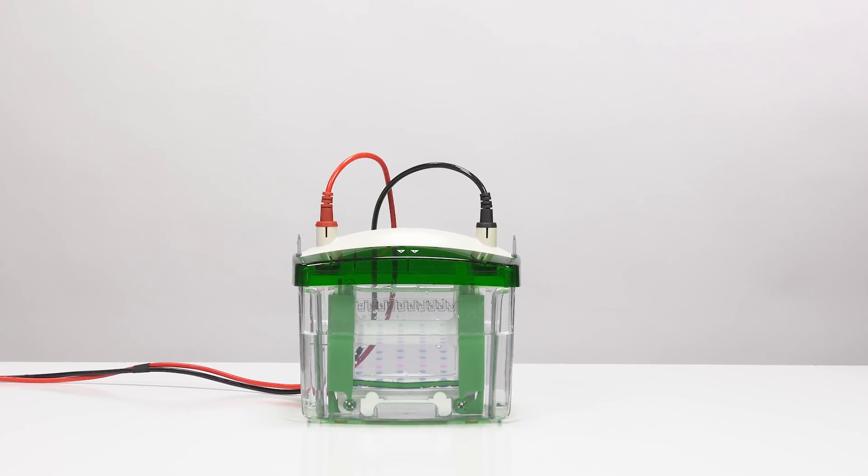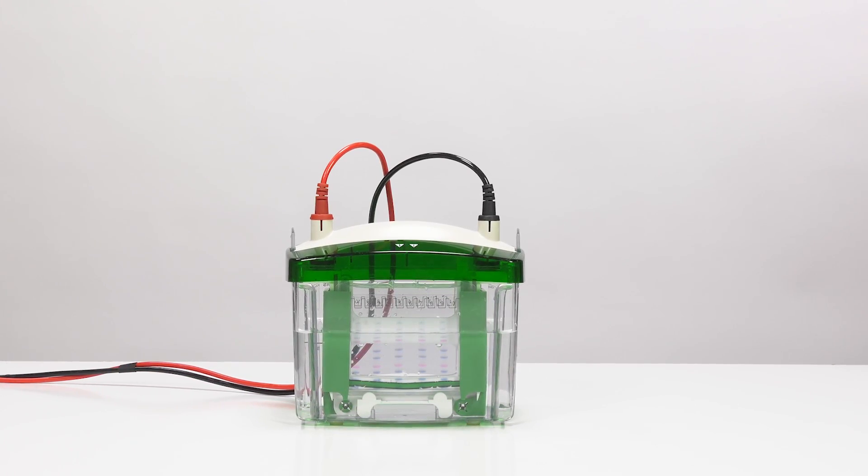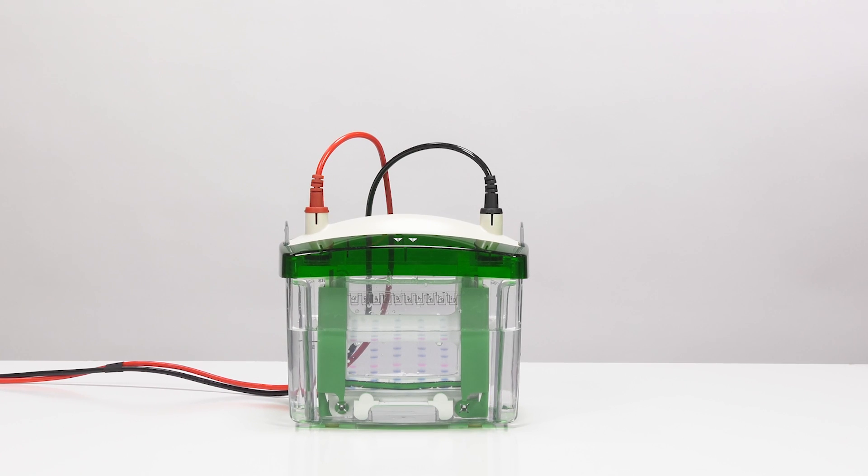In this video, we will show you how to process and prepare your gel for western transfer after electrophoresis.